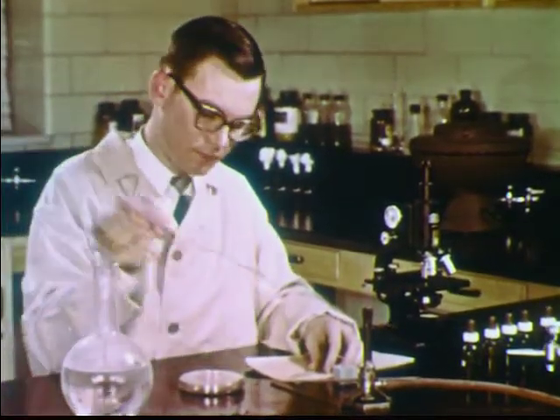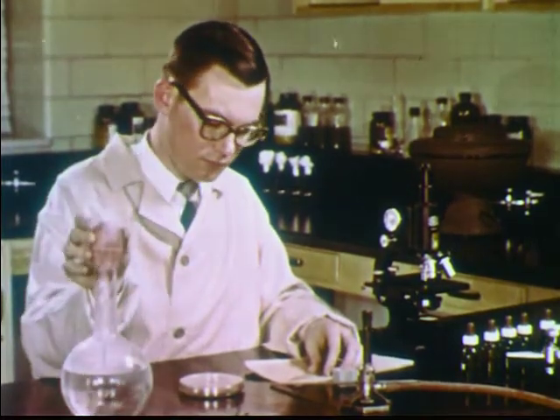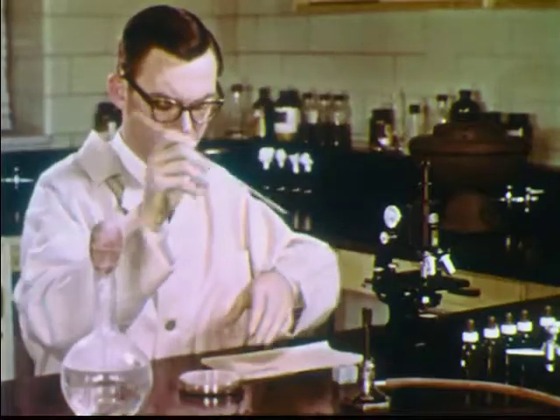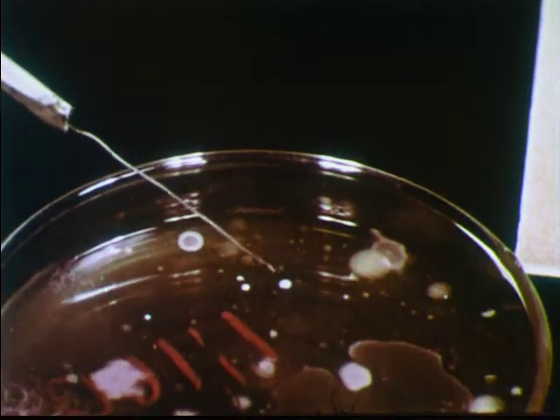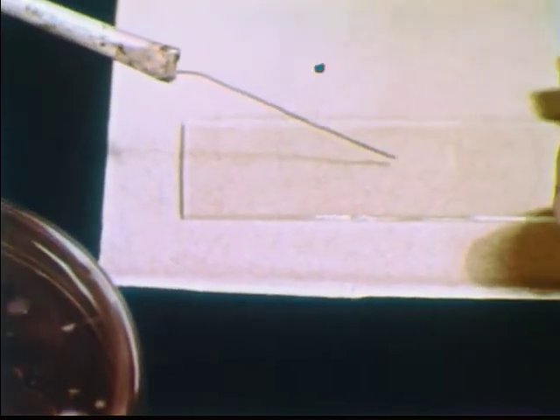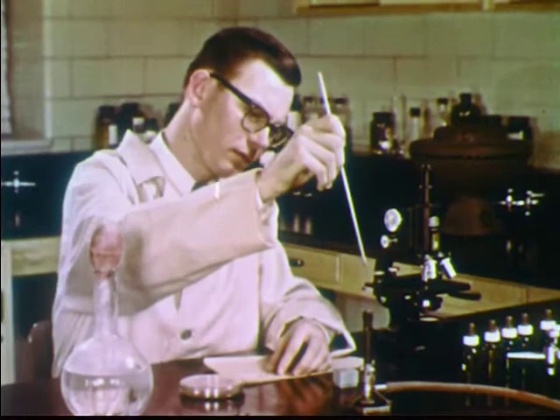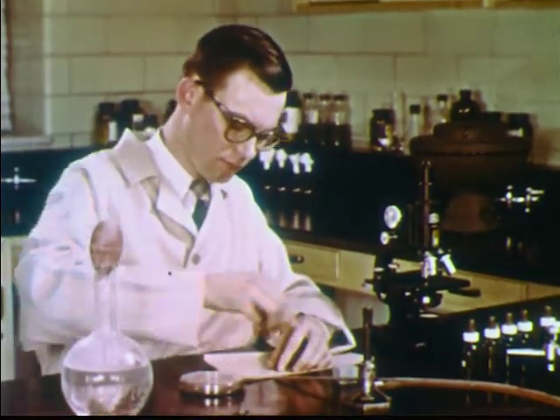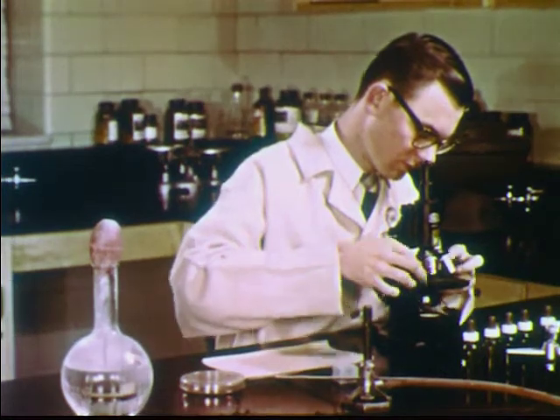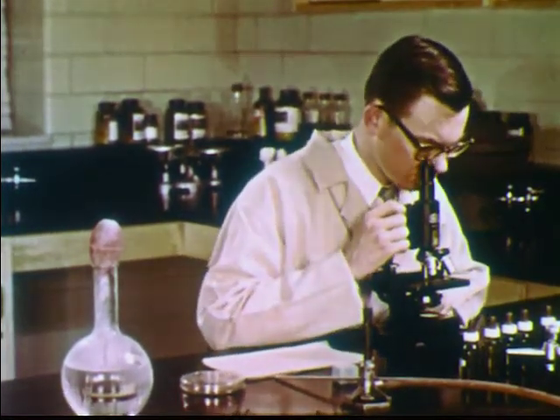To examine the bacteria from a colony, a drop of water is placed on a glass slide. A wire transfer needle is sterilized in the flame of a burner to destroy any bacteria which may be present. After the needle has cooled, a portion of a colony is picked up and transferred to the drop of water. The needle should be sterilized in the flame after as well as before each use. A cover glass is then placed over the preparation. With the high power objective, living bacteria from the selected colony become visible.